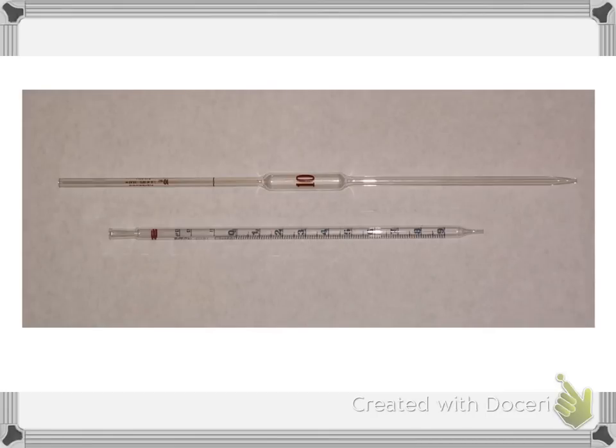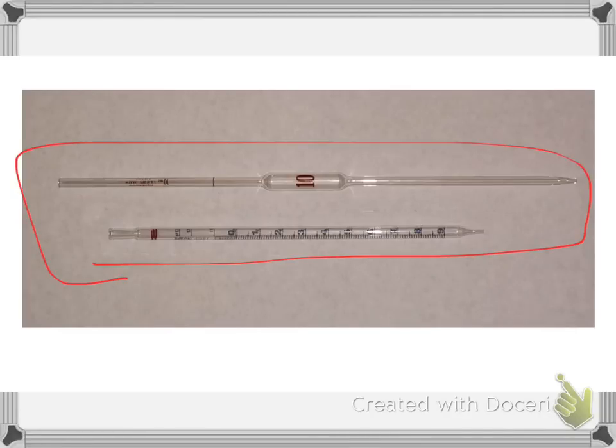Okay. So we're going to take that stock solution and we're going to pipette some of it. Now, there's two different types of pipettes that we have, these dispensing pipettes. Let's say I wanted a 10 milliliter pipette.